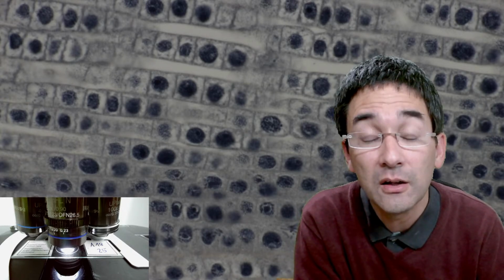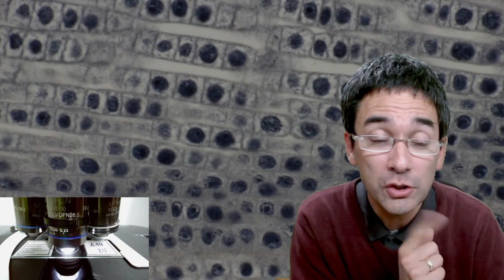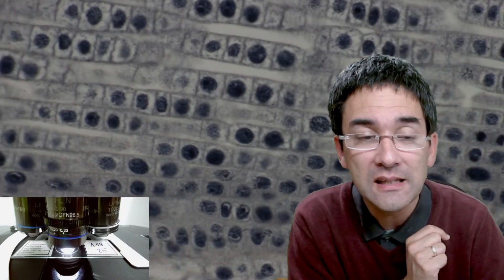It's a powder, and I think it's also used as a food coloring, carmine acetate, and this is the stain that is, it's red. This one is more purplish, but carmine acetate is also a standard stain that's used to stain DNA. Methylene blue can also be used to stain DNA. So there are a variety of stains possible. Okay, carmine acetate is the one.